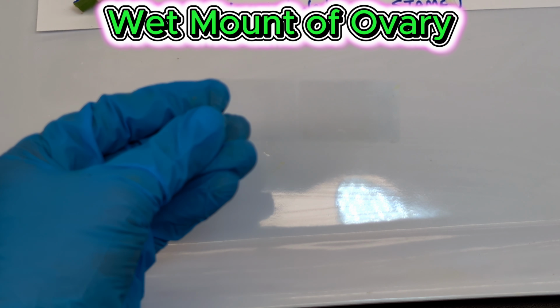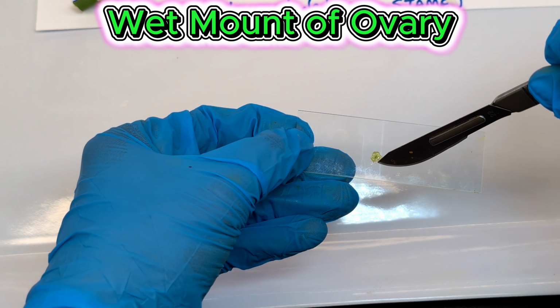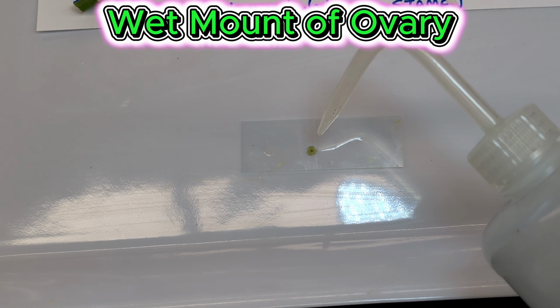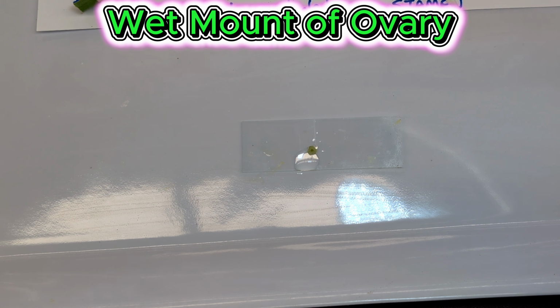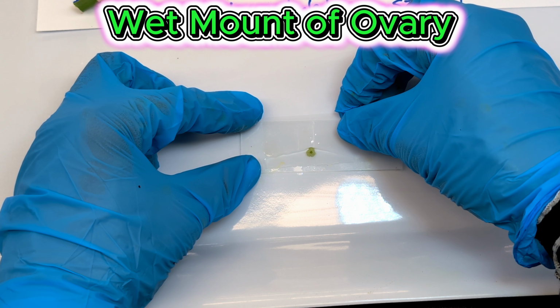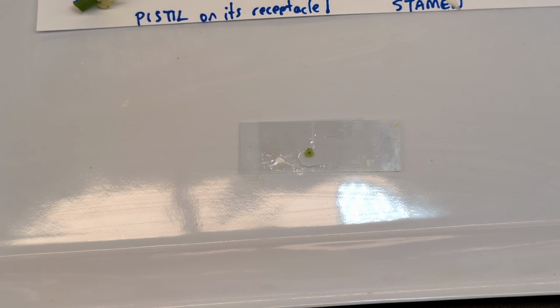And now to make our wet mount, we would take our microscope slide. So here's our microscope slide. And we're just going to put the cut ovary right there in the middle. Using a wash bottle or a dropper, just add about 1 to 2 drops of water and then cover with a cover slip. Okay, and we will put the cover slip at about a 45-degree angle and just put it on there.